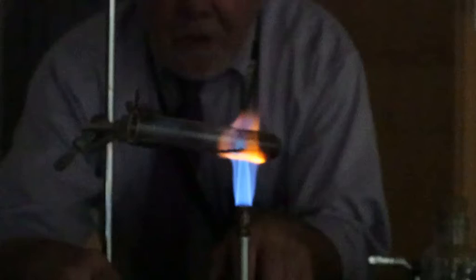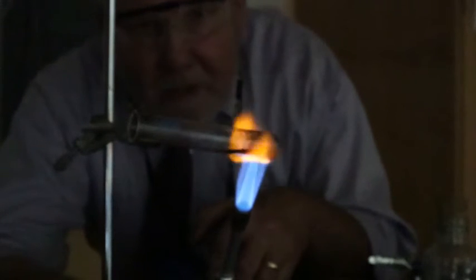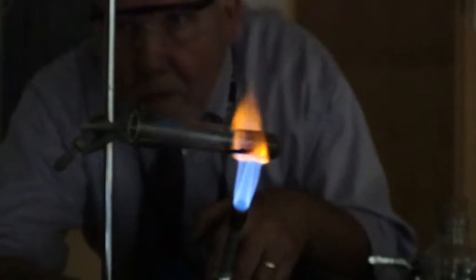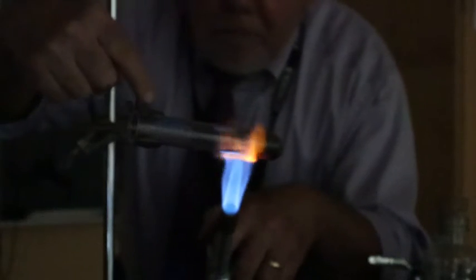All right. So I've got a nice hot flame. I want to see that little cone, the tip of that flame. I want that to be right there. Right there. Yeah. And I'm going to kind of mix it up. I also want to go up here and heat up here where I see this moisture, this liquid, whatever this liquid is. I don't want that in the test tube.